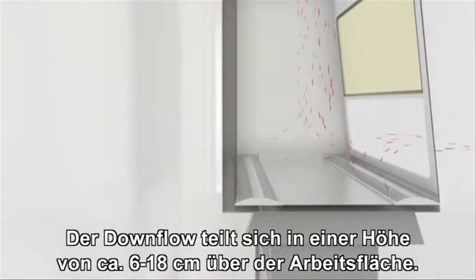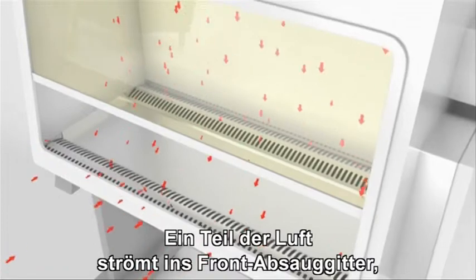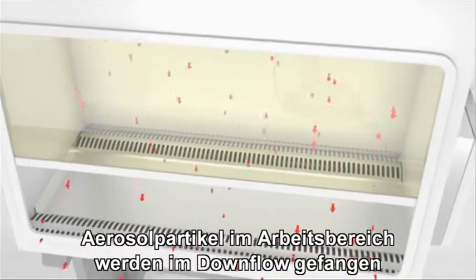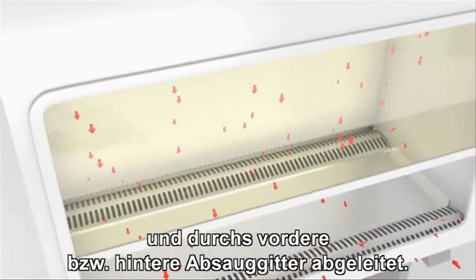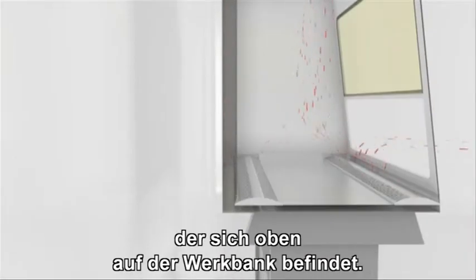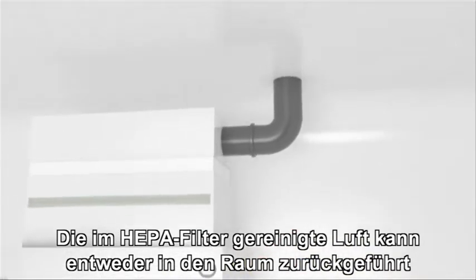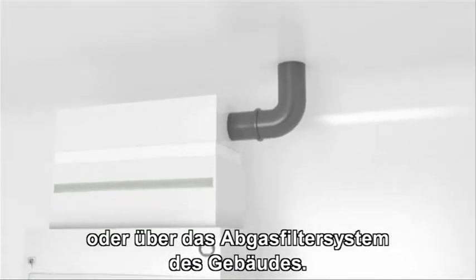This downward flow splits about 6 to 18 centimeters from the work surface, one half of the air passing through the front exhaust grill and the other half passing through the rear exhaust grill. Any aerosol particles at the work surface are immediately captured in this downward airflow and pass through the front or rear exhaust grills, achieving a very high level of protection for the operator and the environment. The air is then discharged through the rear plenum into the space between the supply and exhaust filters located at the top of the cabinet. HEPA-filtered air from the exhaust can be recirculated to the room or discharged to the outside of the building through a dedicated duct or through the building exhaust system.